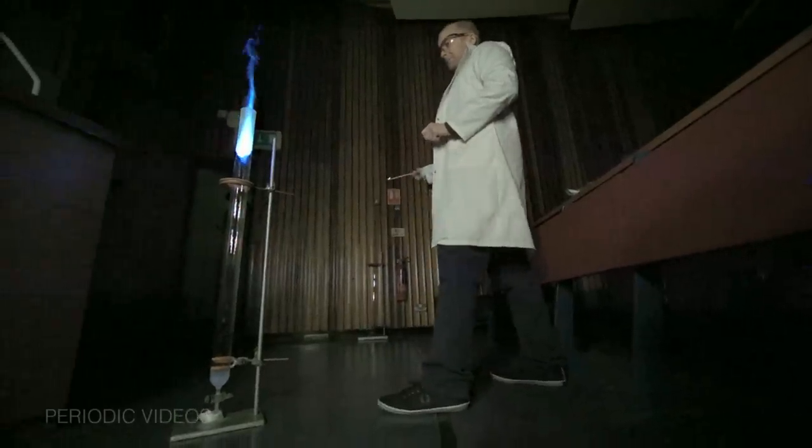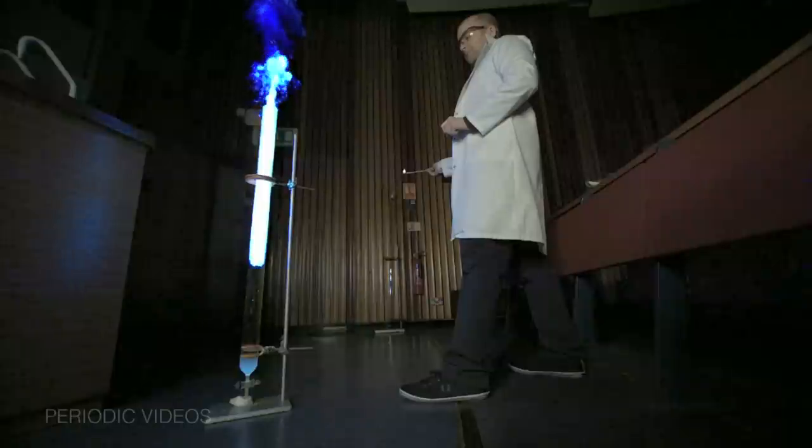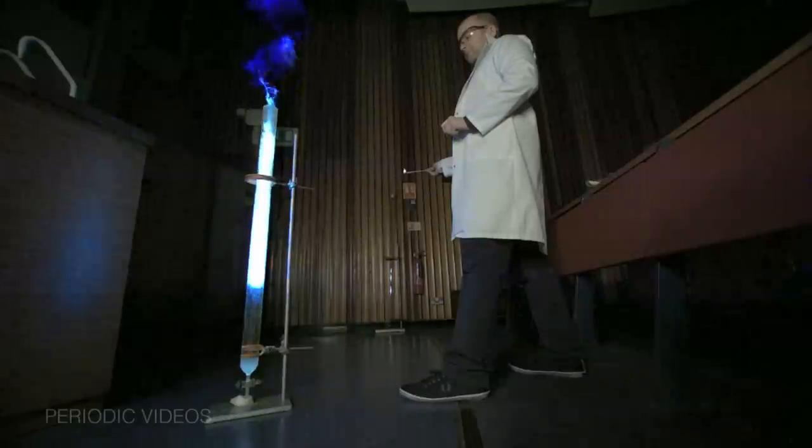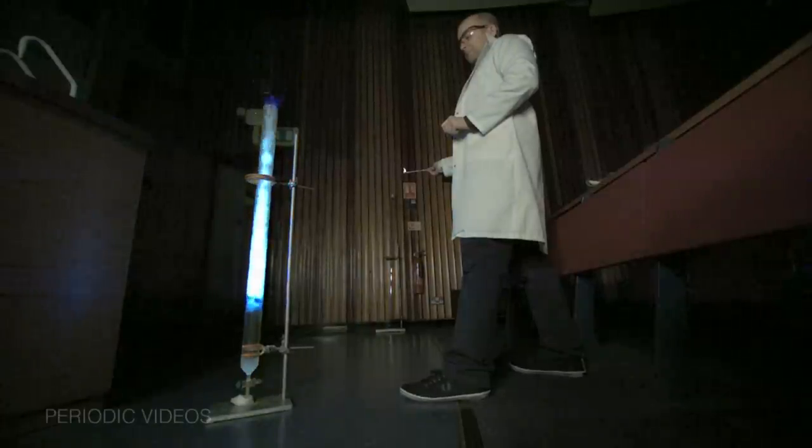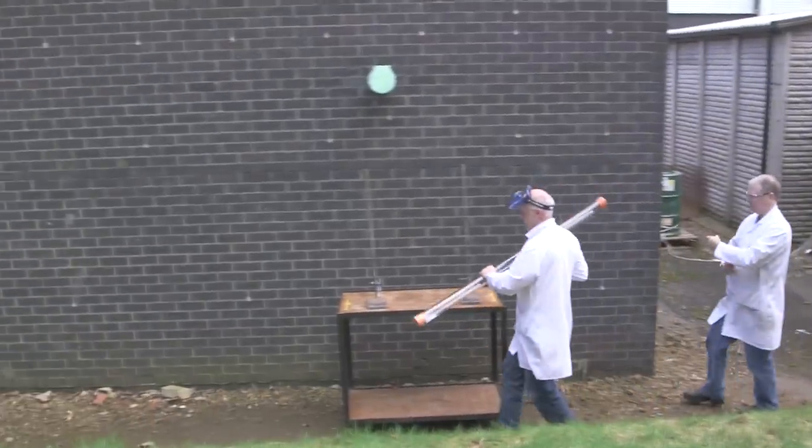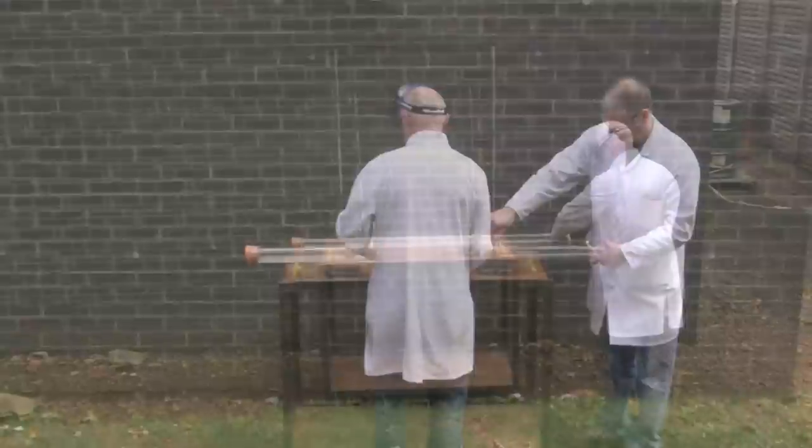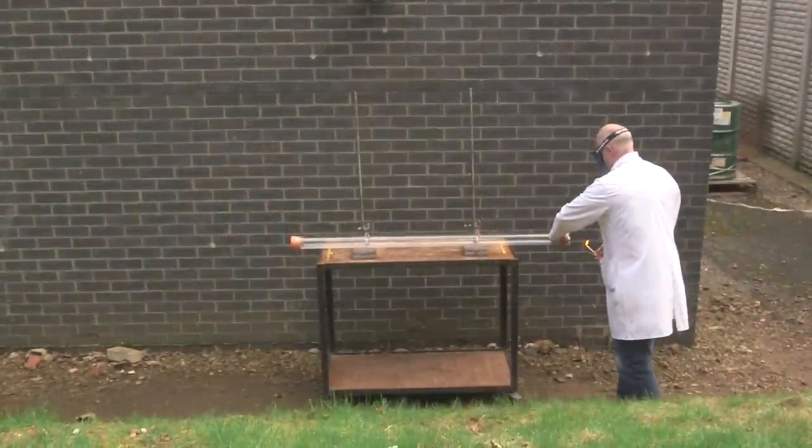And when we recorded it in slow motion, we realized we didn't understand the reaction as well as we thought we did. So now we've decided to explore it a bit further. And the first thing we decided to do was instead of having the tube vertically, to have it horizontally. I have never seen the experiment done anyway except vertically. So this may be a real first.